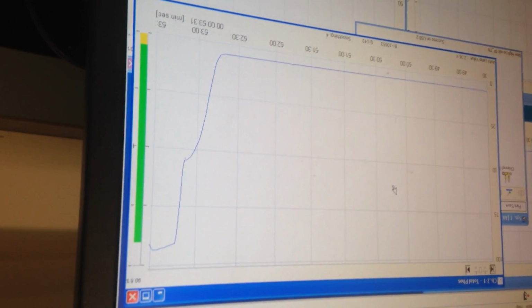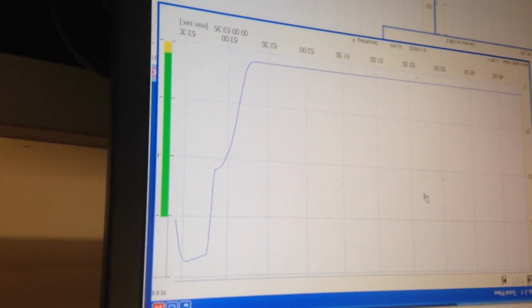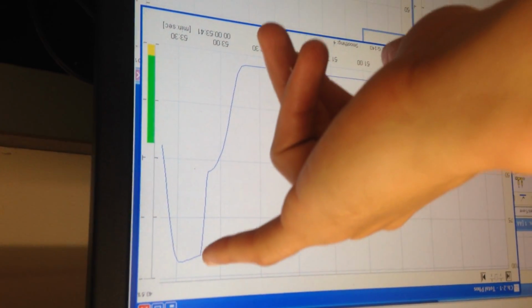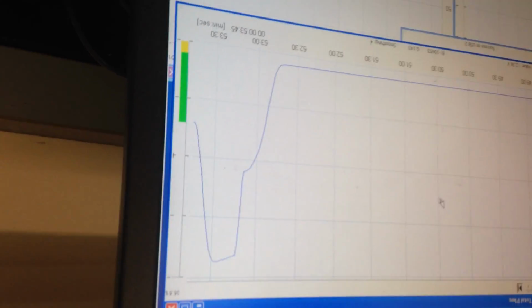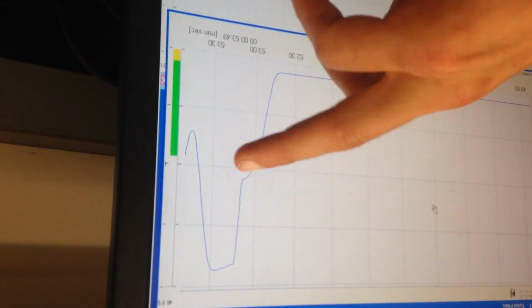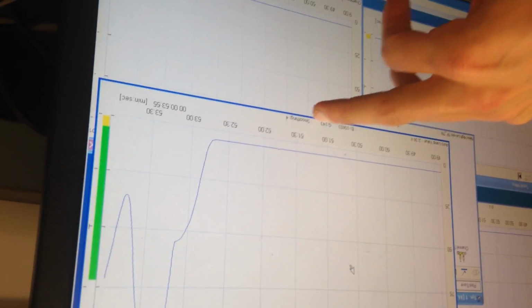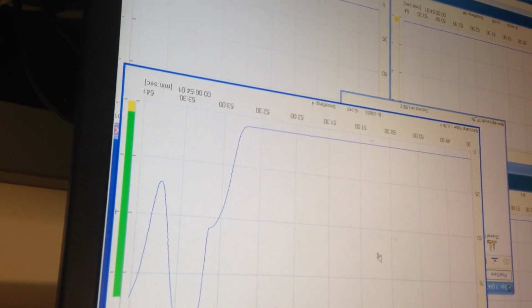That digestion. Maybe when that's because of the low signal. So I still wanted to make sure. I still need to have a spike up there. So as it was with the gain set at 85, it was going to plateau at 55%. So I set gain to 143 from 85. And now we should have an appropriate spike.